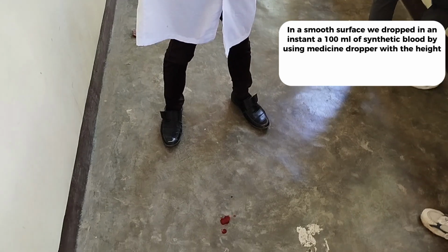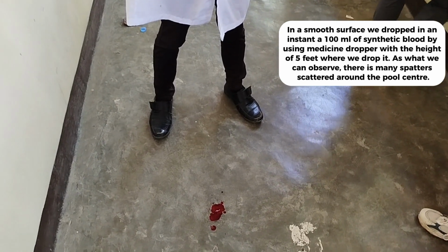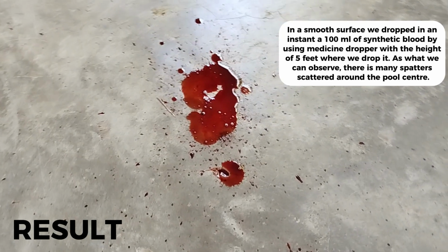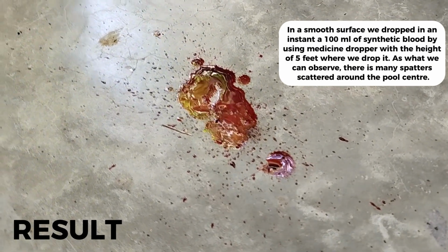rough surface. On a smooth surface, we dropped, in an instant, 100 milliliters of synthetic blood using a medicine dropper from a height of 5 feet. As we can observe, there are many spatters scattered around the pool center.